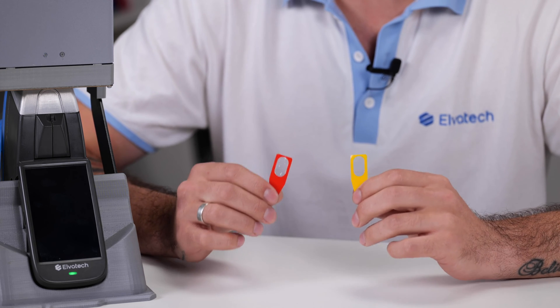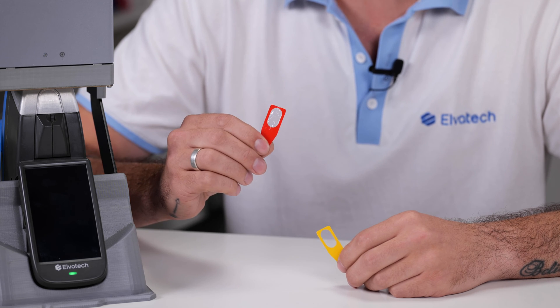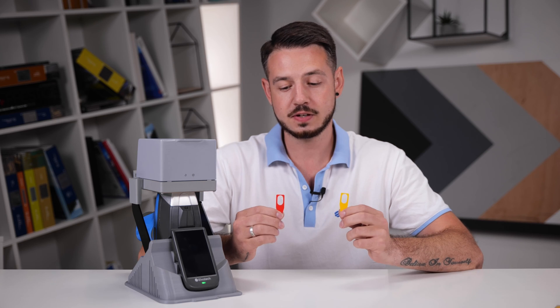Note that different materials may leave traces on the cartridges. For example, aluminum alloys may leave aluminum particles that can significantly affect the accuracy of other samples, especially those containing light elements. In such cases, replace the cartridge before analyzing other materials. Remember, regular and proper replacement of the protective cartridges is the key to reliable and accurate analysis. There are two most common types of cartridges: for analysis of light elements and without light elements. The difference between them is in thickness.